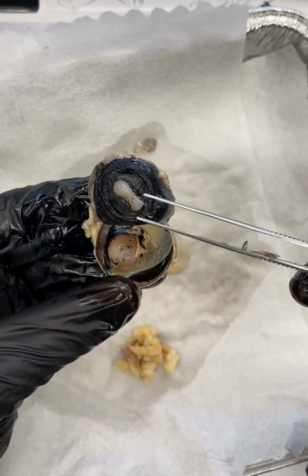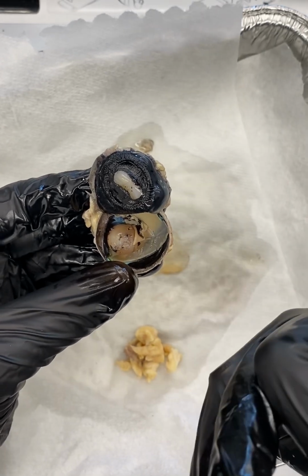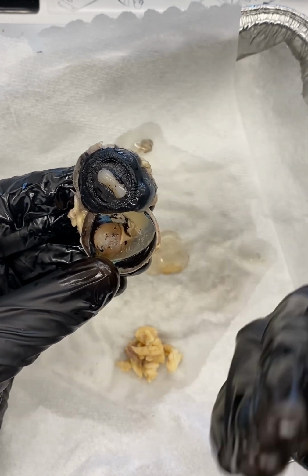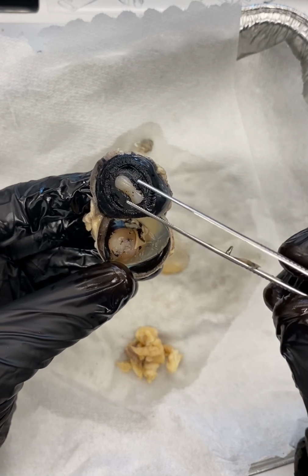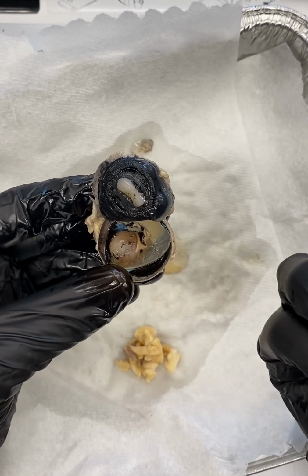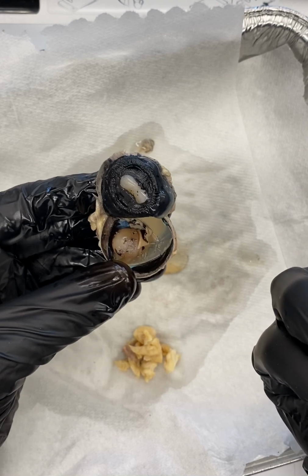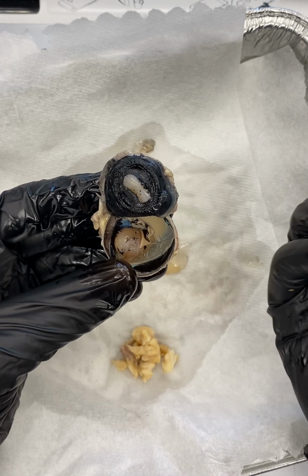Well, this is something called accommodation, okay? And what this is doing is allowing for near and distant vision, okay? So it's allowing you to see things at a distance, and it's allowing you to see things up close, okay? And so when the lens is more rounded, that is much better for near vision, okay? When the lens is more flat, that is better for distance vision, okay?